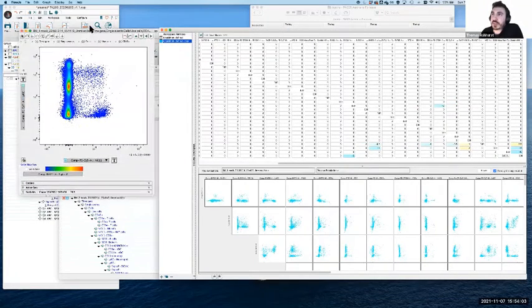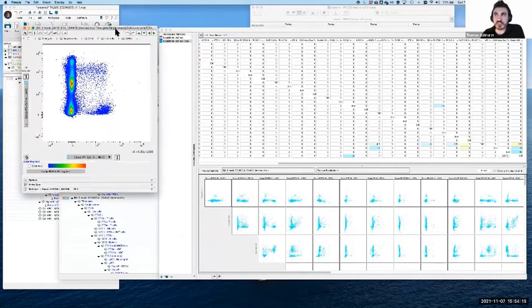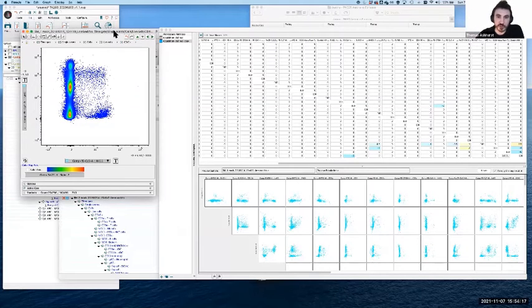The reason for this is because this is not compensation. We're actually not compensating one signal, one fluorophore, out of a different detector. We're actually integrating signals together. And this matrix of zeros is really just to allow this data to show up in FlowJo in a way that's consistent, because otherwise FlowJo thinks you're dealing with uncompensated data, and that creates some problems. So it gives you a matrix of zeros so that FlowJo can see it as if it's compensated, even though there are no values here, apart from the ones where we've been messing with it.